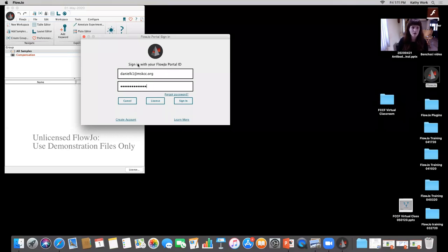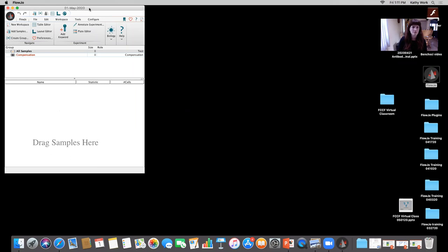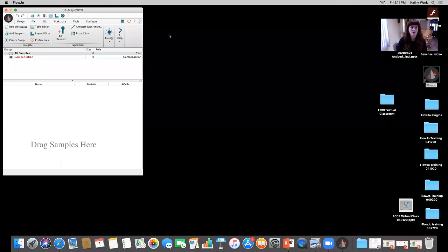Okay. So first I'm just gonna go ahead and sign into the portal, which is how we access a licensed version of FlowJo. So I'm gonna sign in. And you'll see it went from unlicensed, where you can only drag in demo files, to having the ability to utilize the fully licensed version.